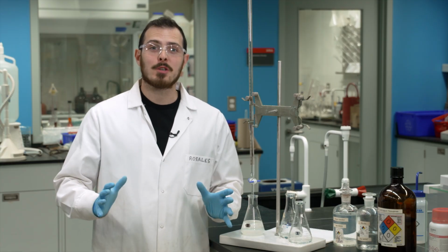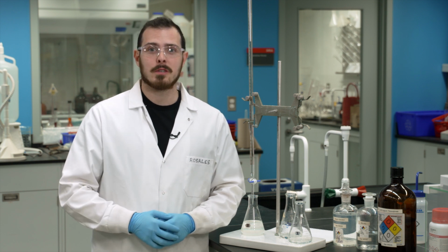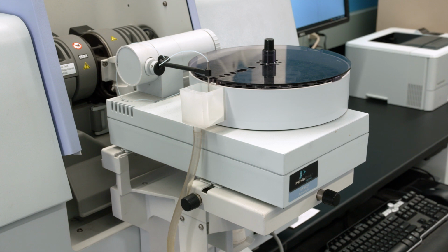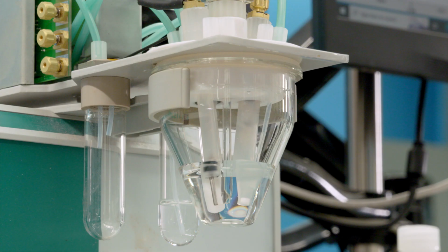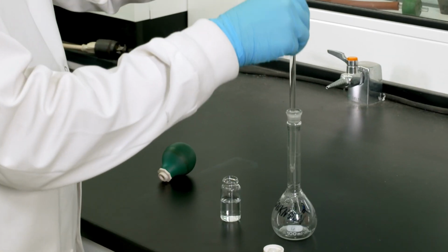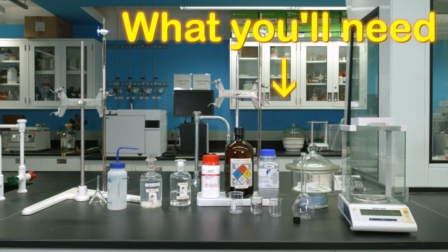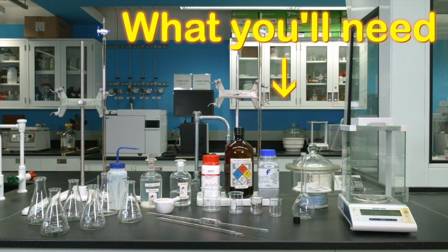Out of all the experiments in this course, this one differs the most. Although we are fortunate to have GCs, LCs, spectrophotometers, and more in our analytical teaching lab at Carleton University, titrations still provide important results. Today, you'll be learning to perform a redox titration to determine the amount of vitamin C in a tablet. Let's get started.